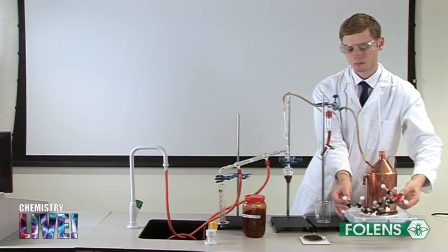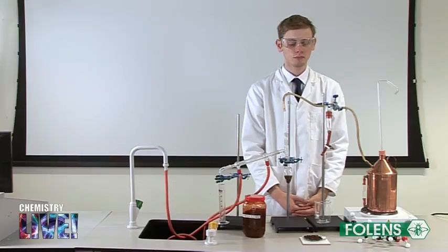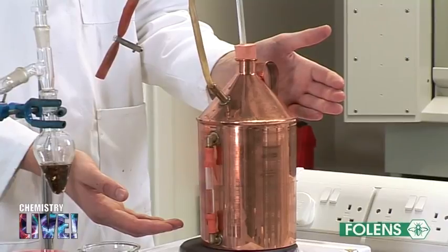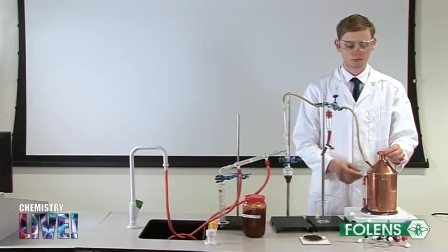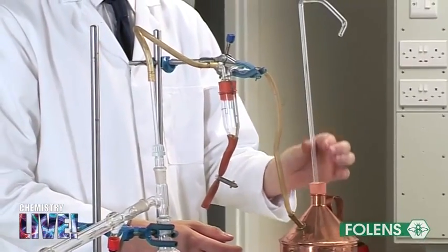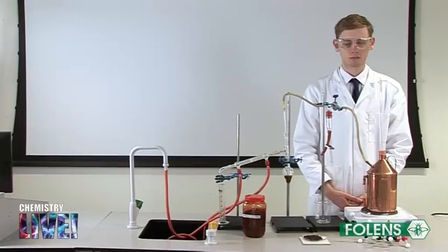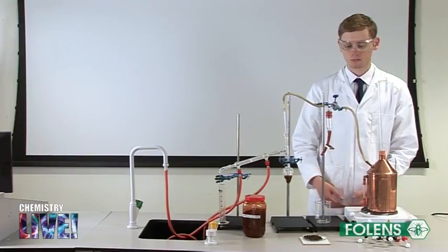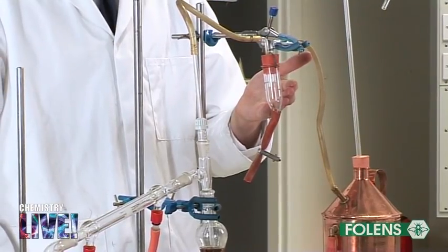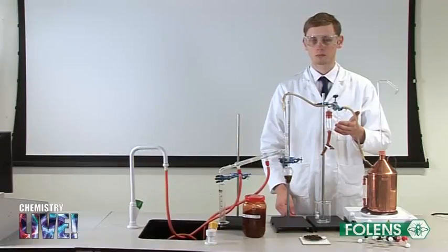Set up the apparatus for steam distillation as shown. Steam is produced in the steam generator, which is fitted with a safety tube to prevent build-up of pressure. The steam trap collects any steam that has condensed to water; if it were not present, the flask containing the cloves would quickly fill up with water from the condensed steam.